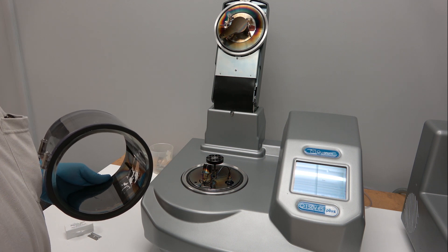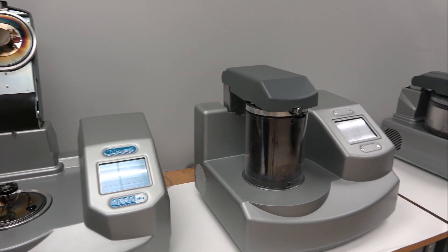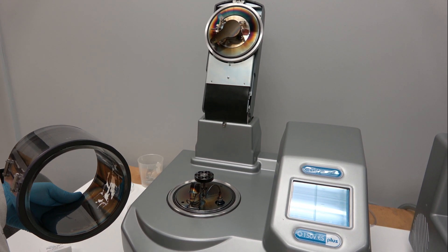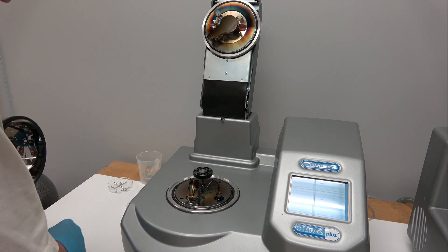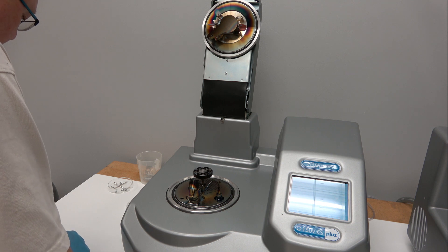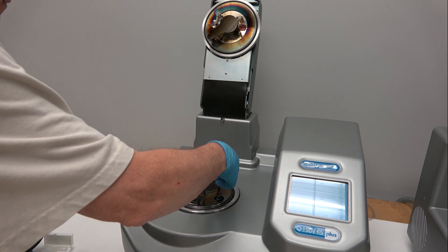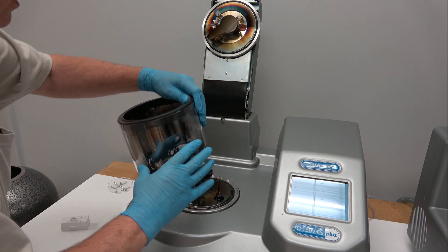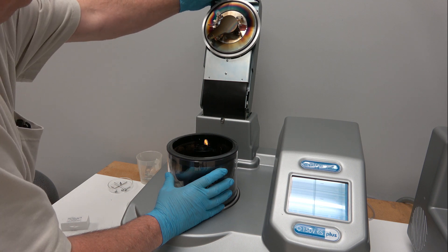If you're doing other profiles or using the extended chamber, which you see on this machine, it is possible to employ the film thickness monitor for your process. The specimen stage is usually left at 60 millimeters above the floor of the chamber. Just for demonstration purposes I have a piece of cover glass for a slide that we'll use as our substrate, and we'll put the bell jar back in place.